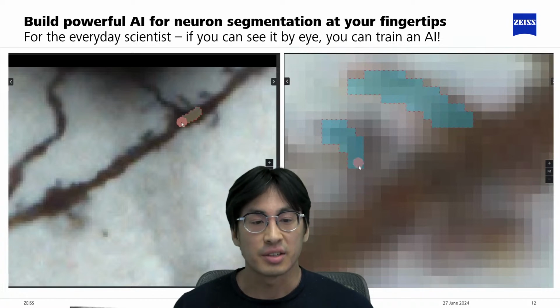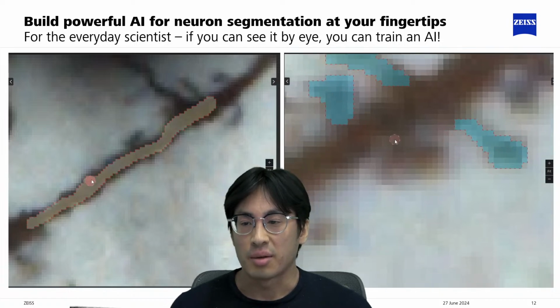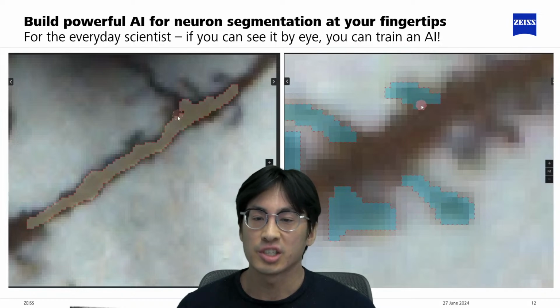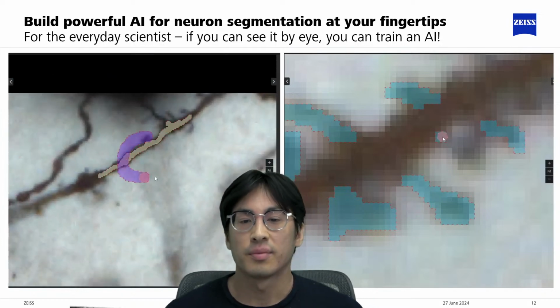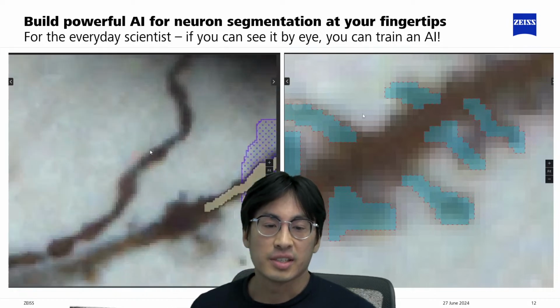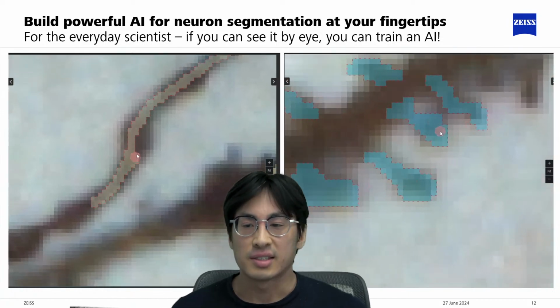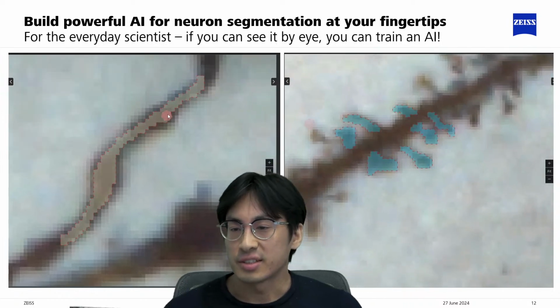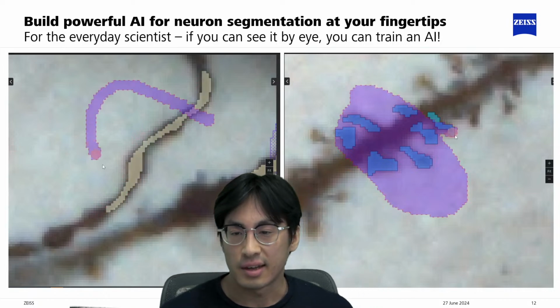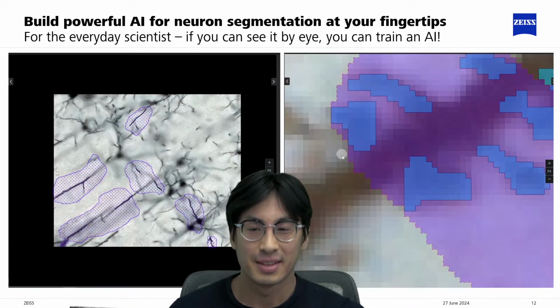For example, segmenting the neurites on the left, where I'm just painting a couple of neurites, not even the entire branch, and on the right, I'm just labeling some spines. So just like a coloring book, just go in and you just draw. And all I'm doing is telling our model what is or isn't the structure of interest, and training is as easy as just painting and clicking train, just as easy as clicking a button.